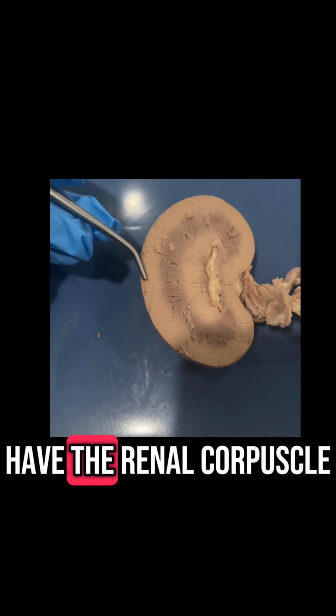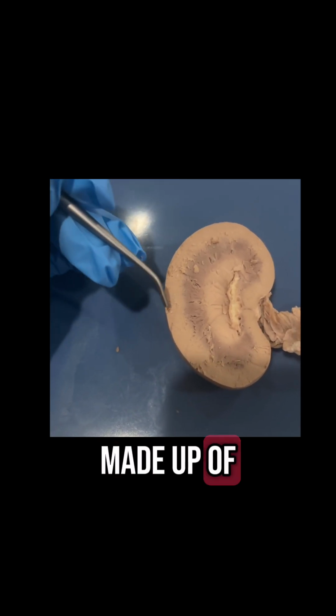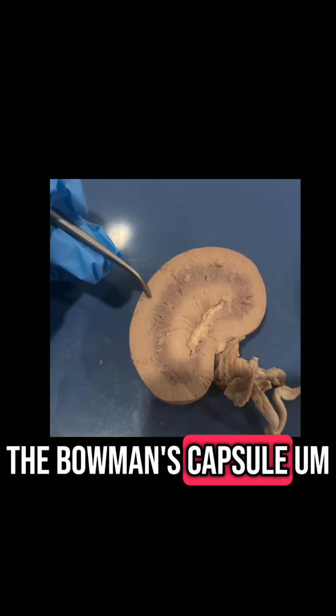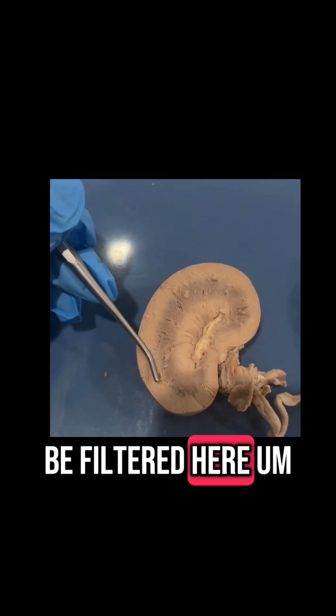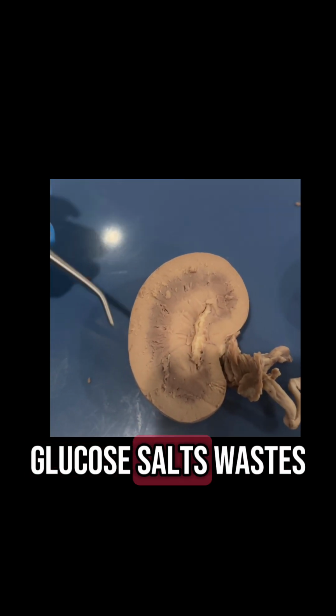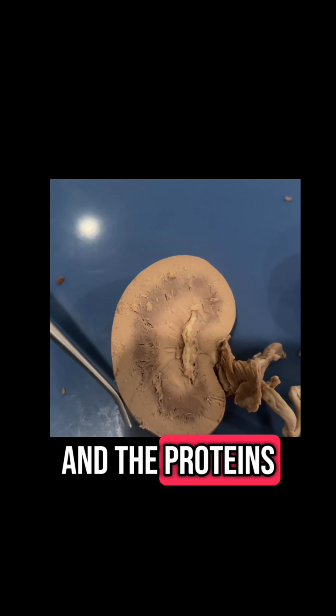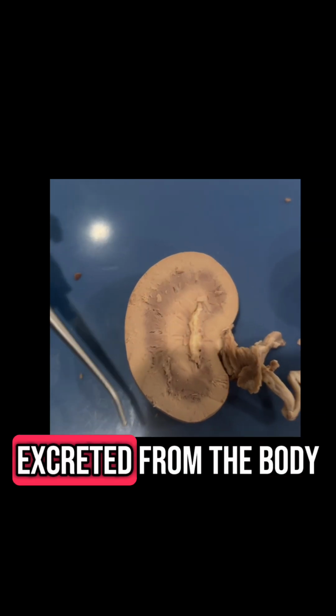Okay, next we have the renal corpuscle, which is also found inside of the cortex here. This is made up of the glomerulus and the Bowman's capsule. The blood is filtered here, and it separates the solutes, like glucose, salts, wastes, and water, from the larger blood cells and the proteins that are going to stay in the bloodstream instead of being excreted from the body.